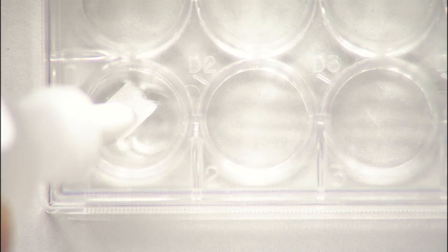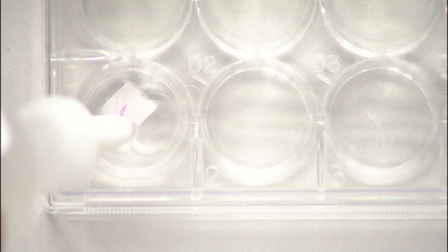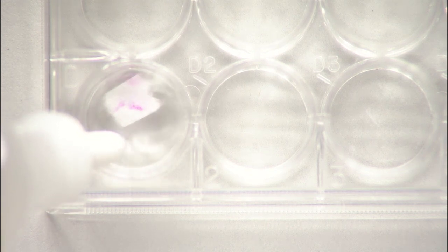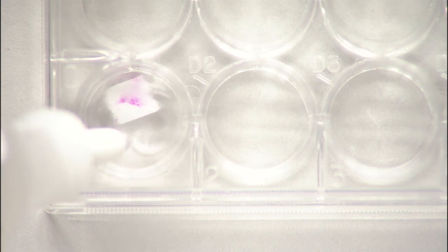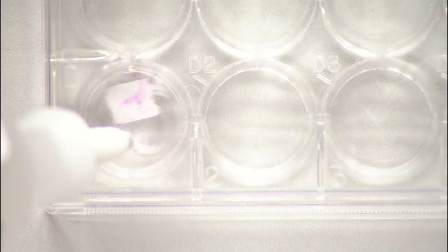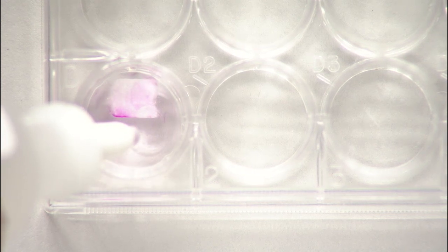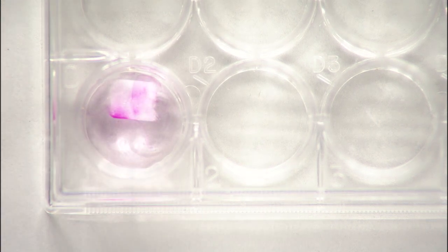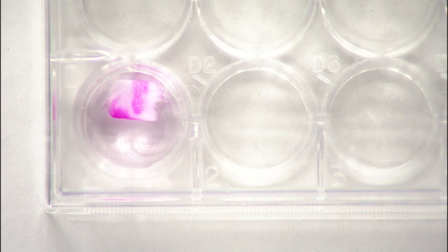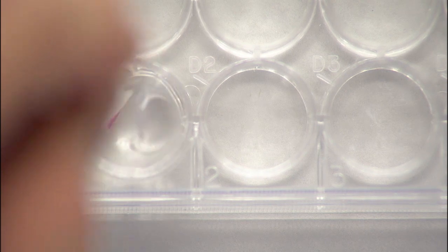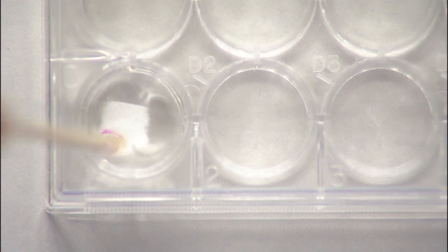1, 2, 3, 4, 5, 6, 8, 9, 10, 11, 12, 13, 14, 15... I do know the number that I'm looking for. I put 20 drops in and I'm going to stir that. You see how the pink color disappears.